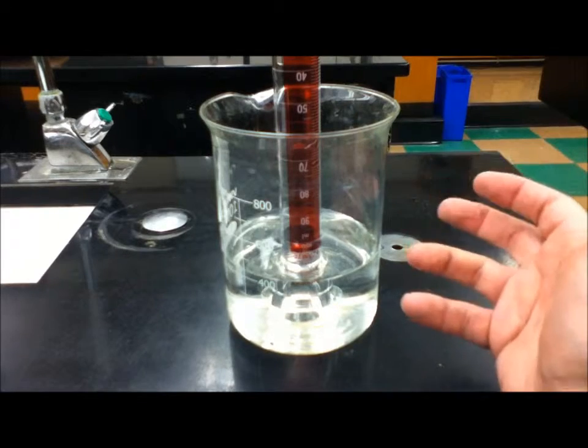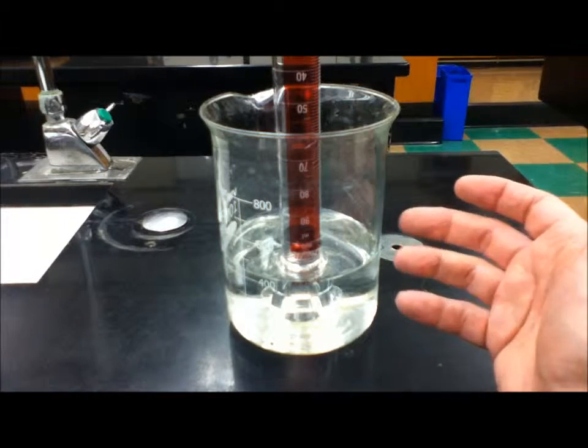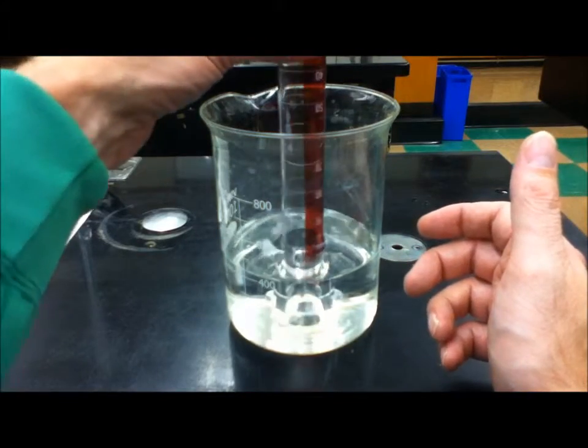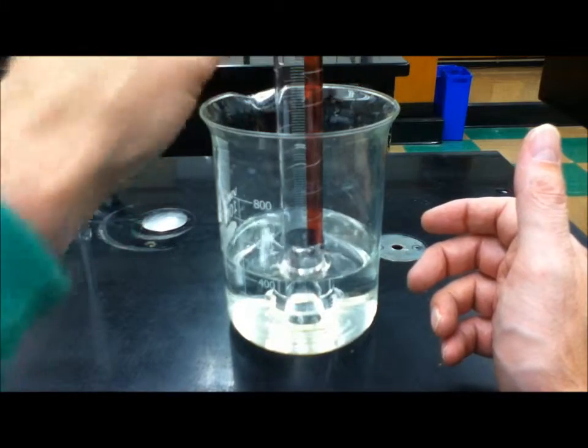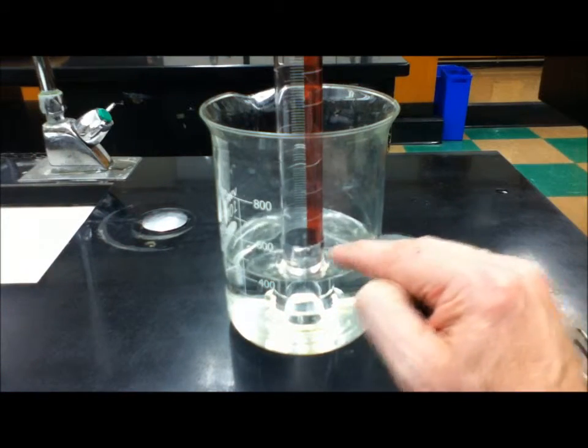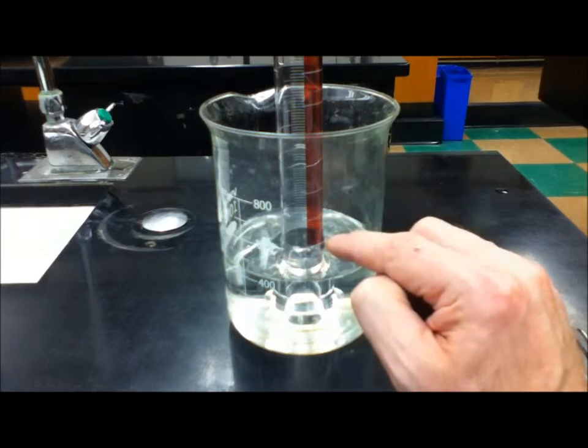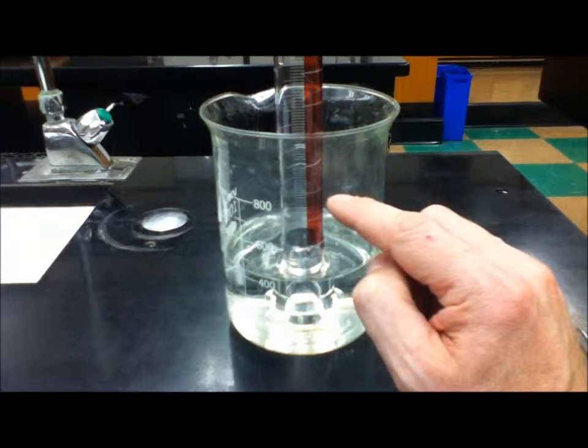Maybe check back here and there at least once a day to see if we see anything happening to the iron wool on the inside and notice if the volume of water inside the cylinder is actually changing.